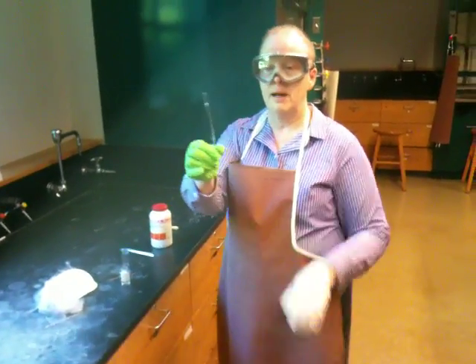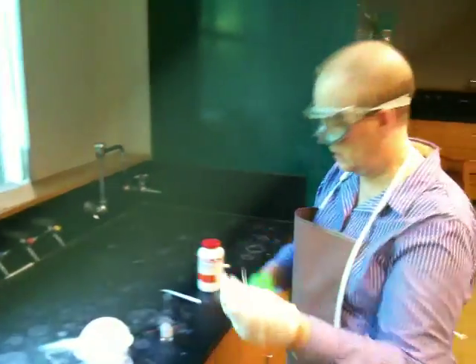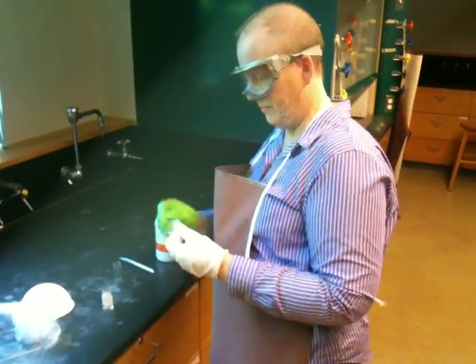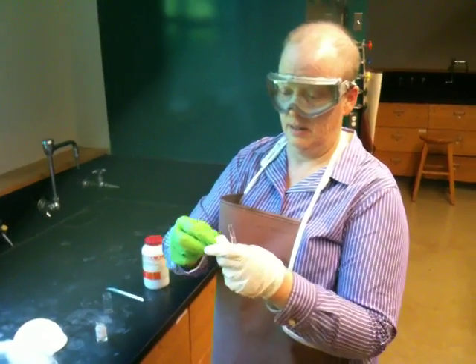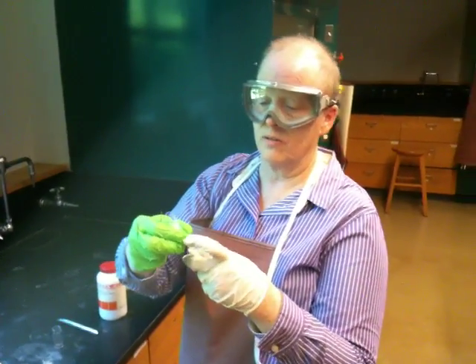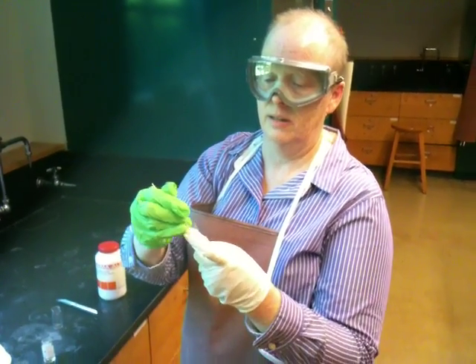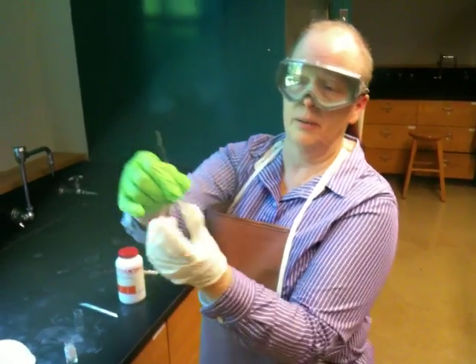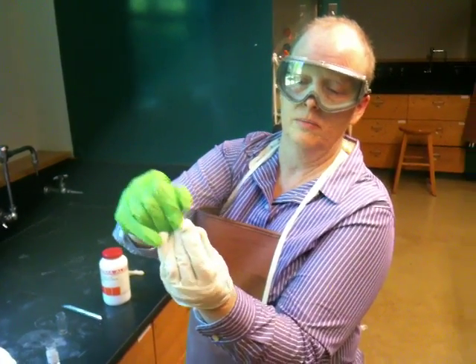And what we do is we take a pipette, just a disposable pipette, we take a little piece of glass wool, and I mean a little piece, like maybe something about that big, so you can see how little that is. It's like nothing. There's no exact amount you have to put in. You don't have to get really fussy about it. All right, and then what you do is, I'm using a little piece of copper wire. You stuff that glass wool into the bottom of the tube.